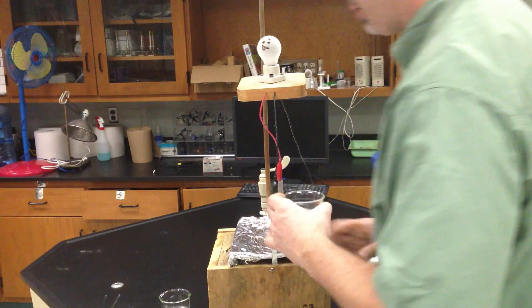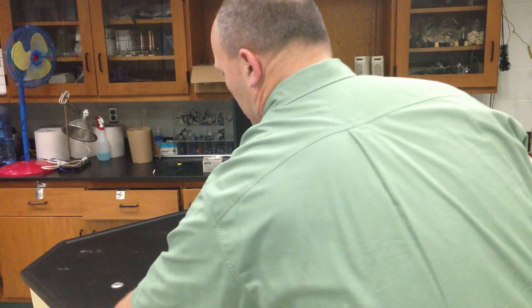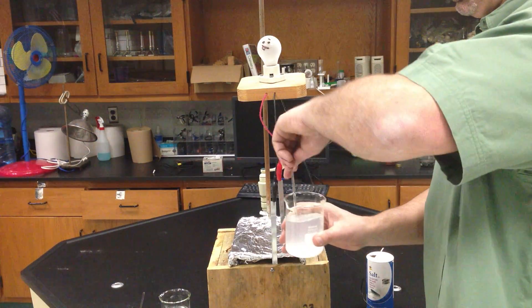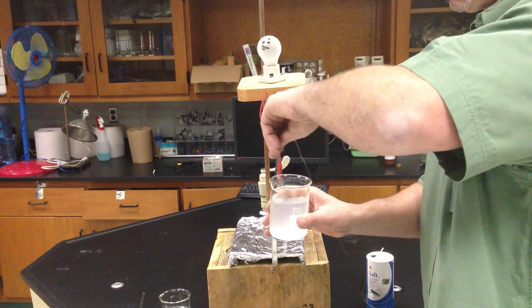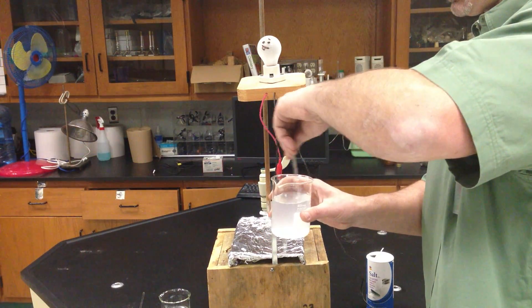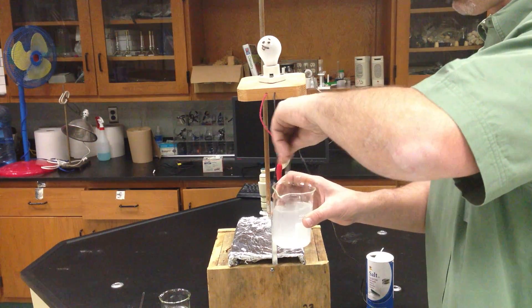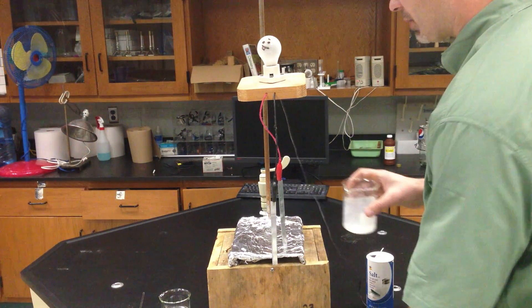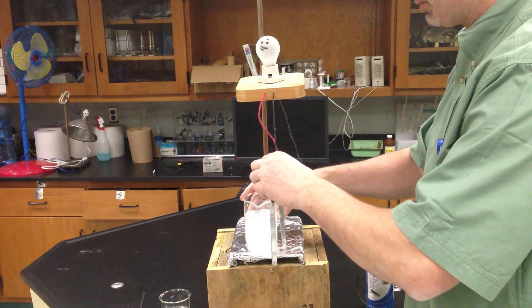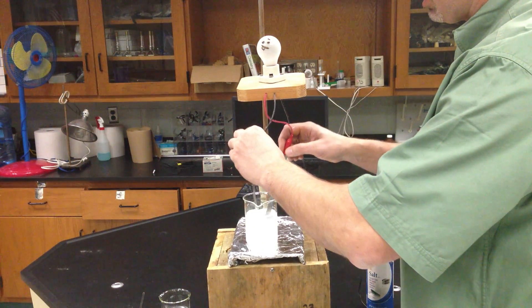And I'm going to stir, as I would normally say, like a banshee. And by stirring, I'm creating molecule-ion attractions, or dipole-ion attractions. The ions are free out of the crystal, and we should be able to conduct a charge in this solution.